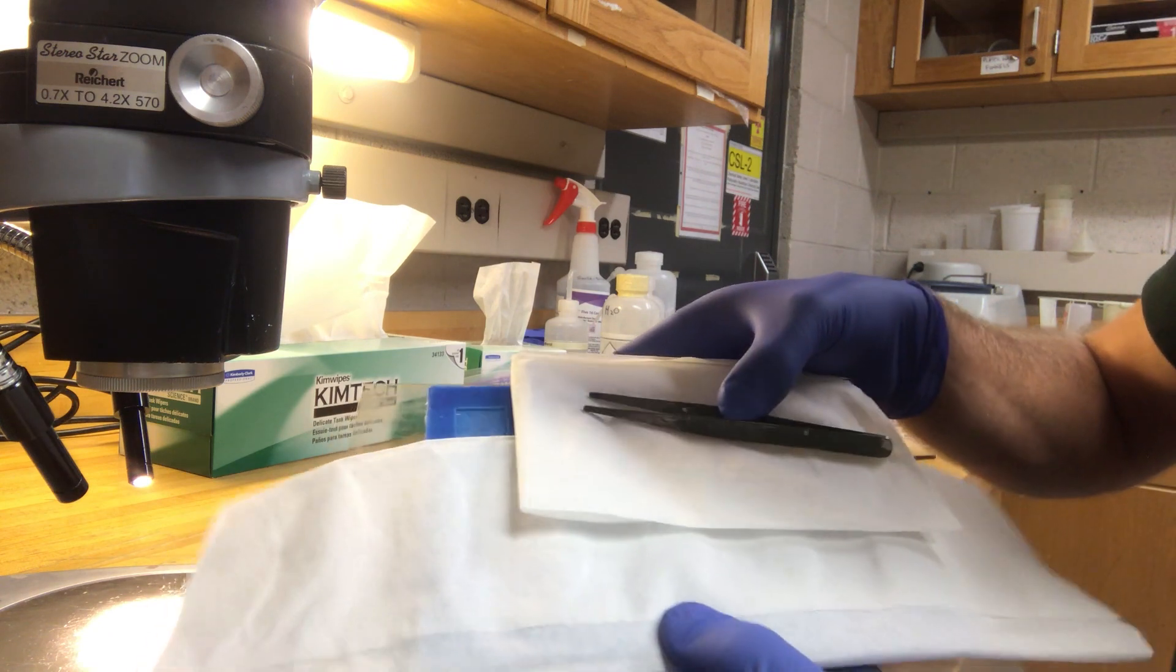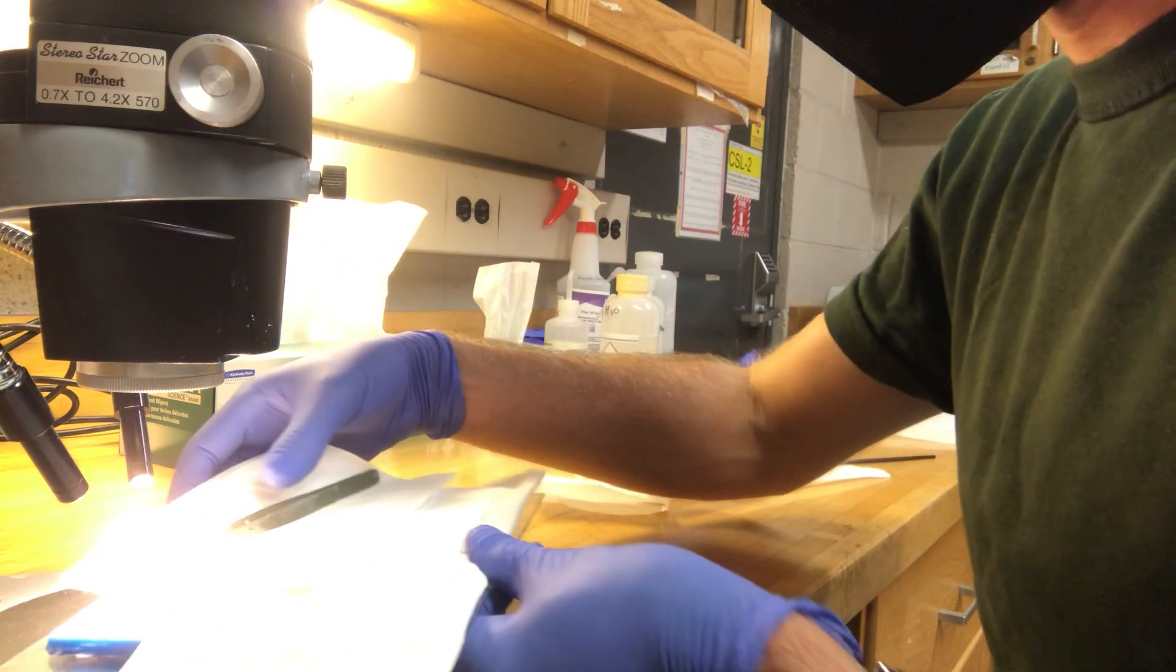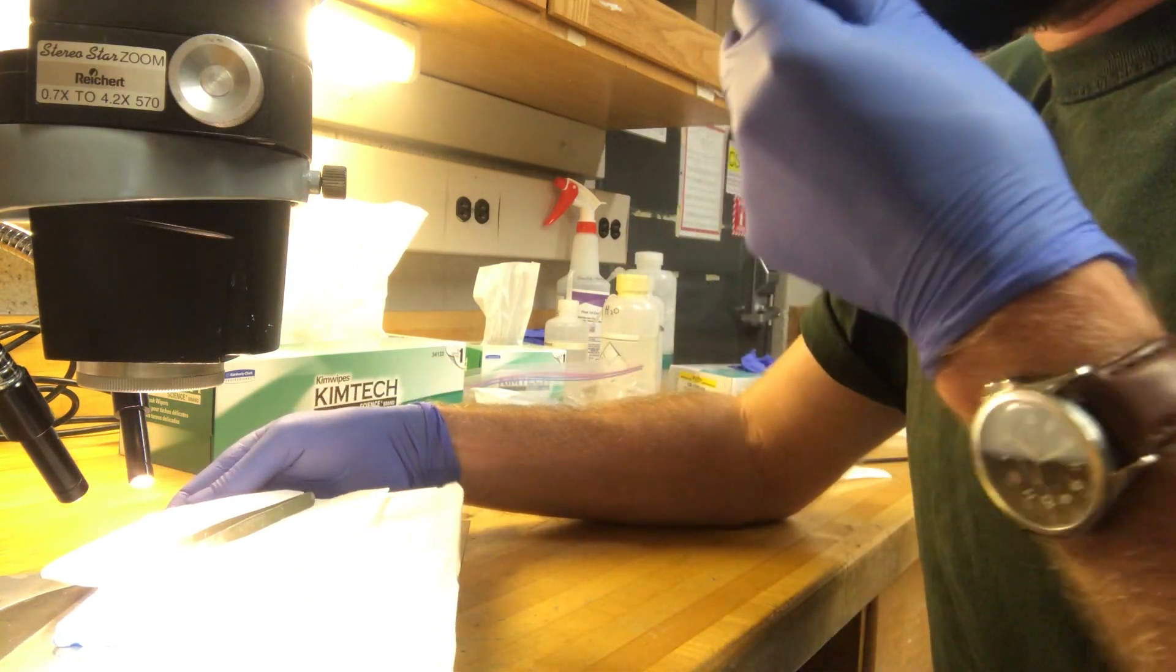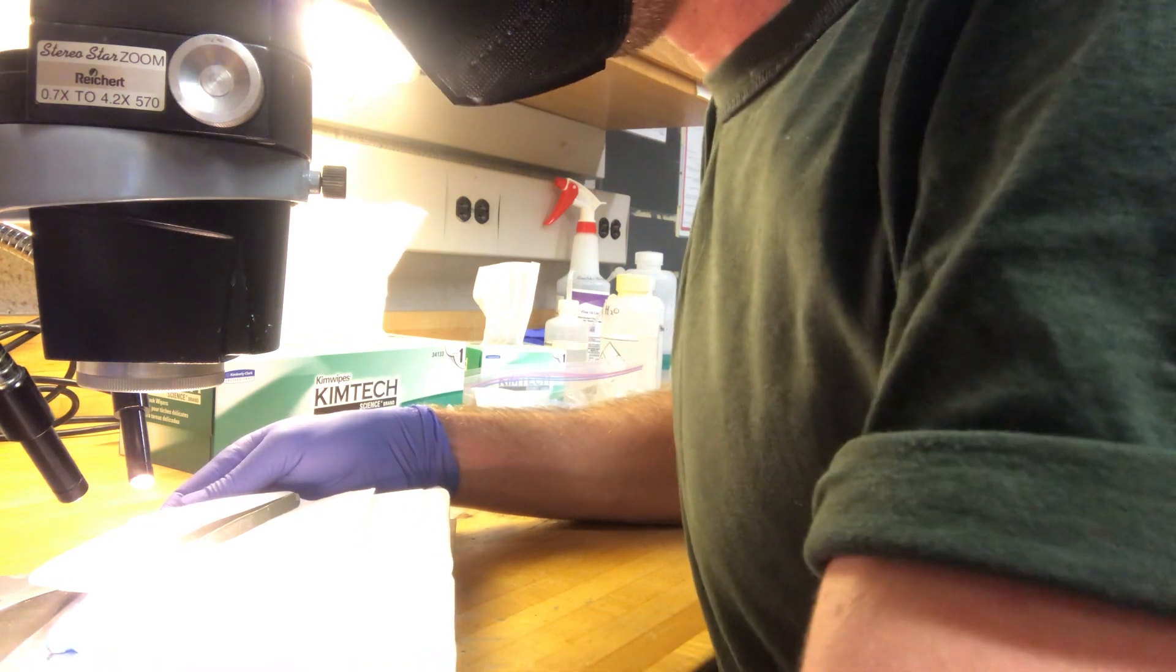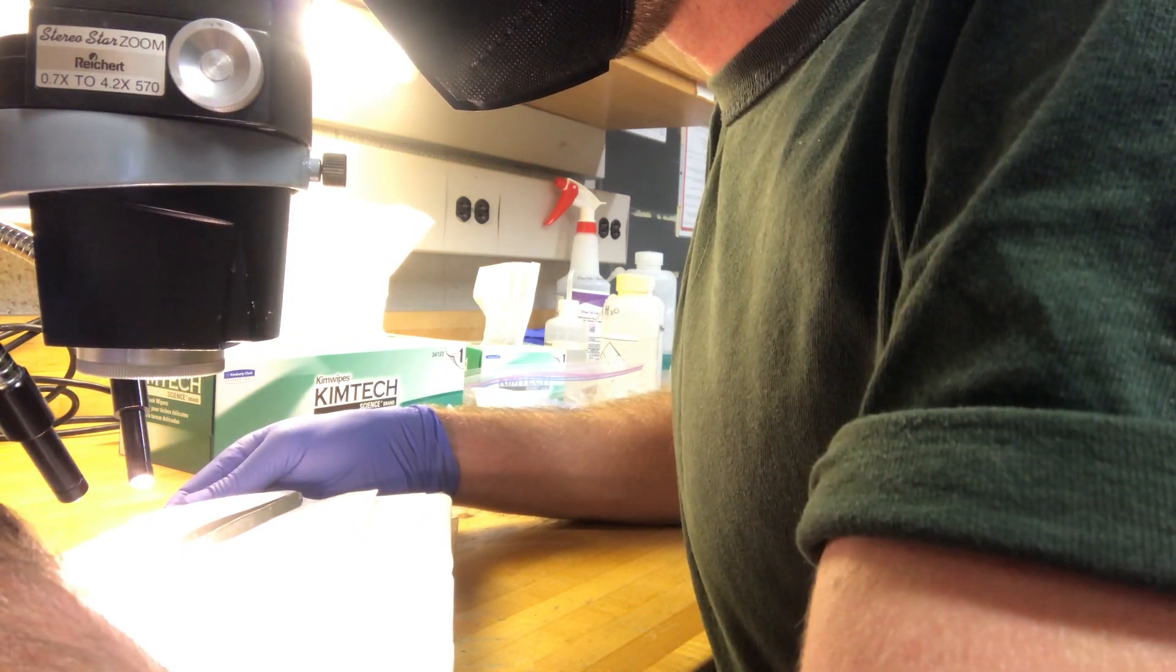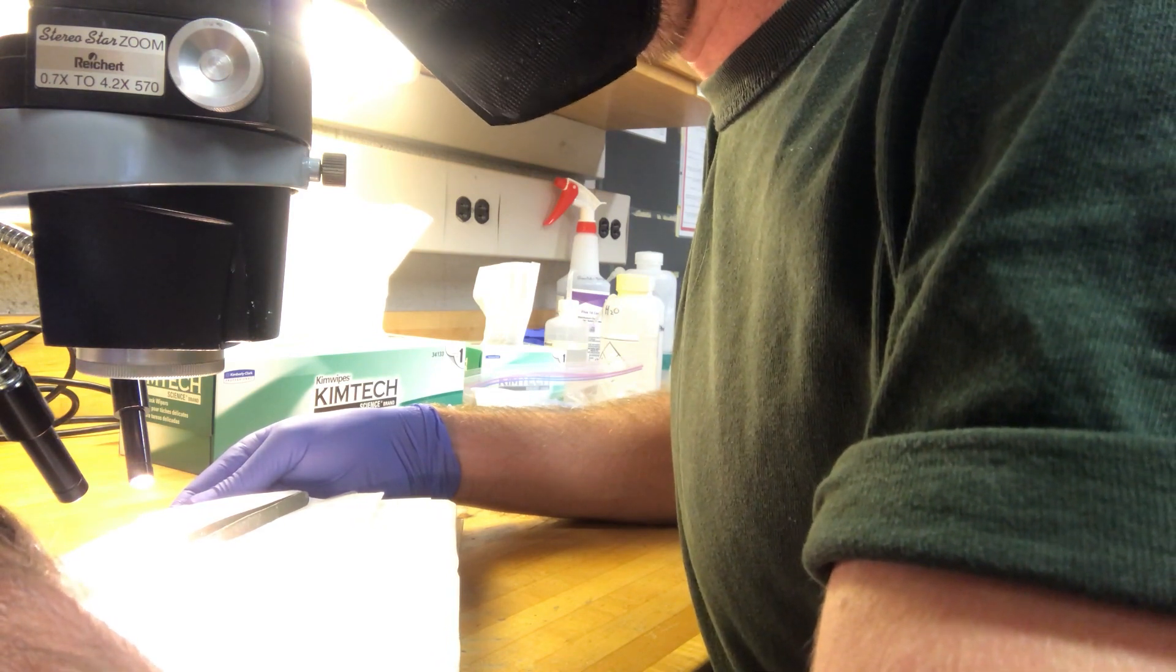You can fold that back up and you'll find you'll have a nice little mount of apatite. You can start to see them. And then if you're concerned about them at all and you want to look at how it's done, you can just check in the microscope. Perfect. Lots of beautiful little apatites.